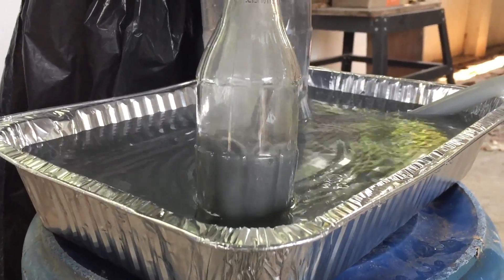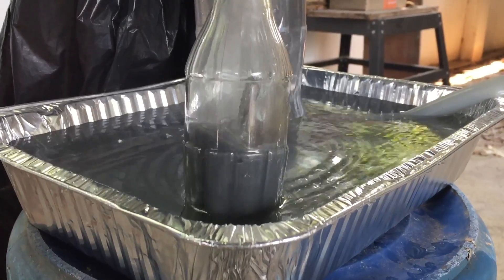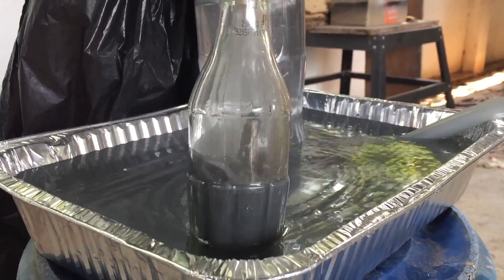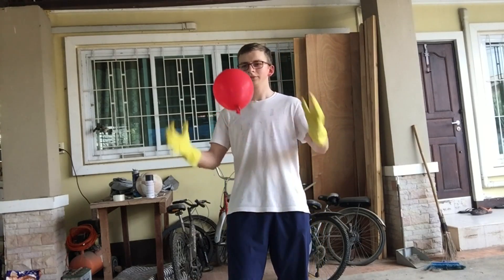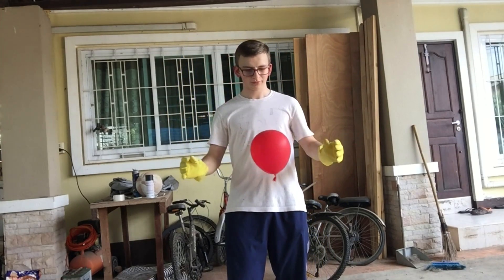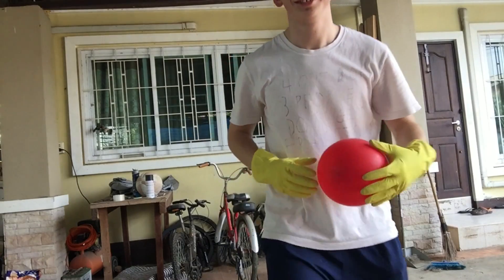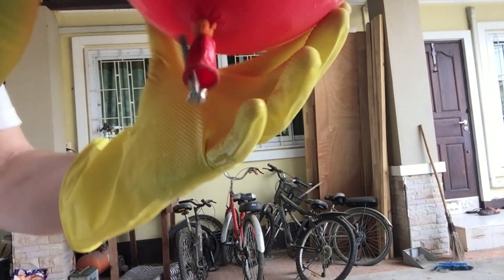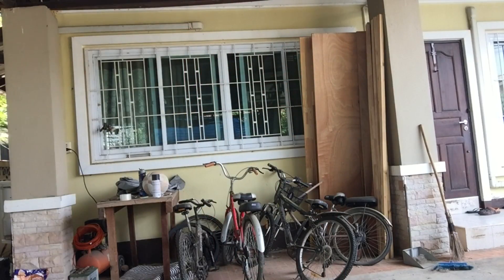I was trying to fill the trash bag but was running out of acid and time, so I settled for a little party balloon. It was really cool just to see it rise — after an hour and a half I finally had this little balloon, which was exciting. I put a little screw in it to weigh it down as I lit it off.